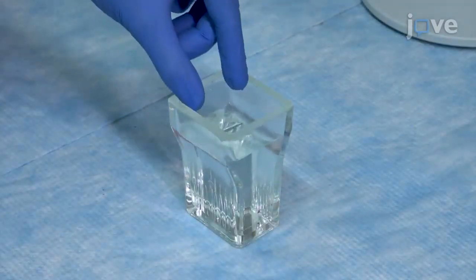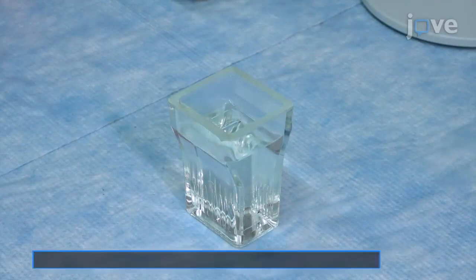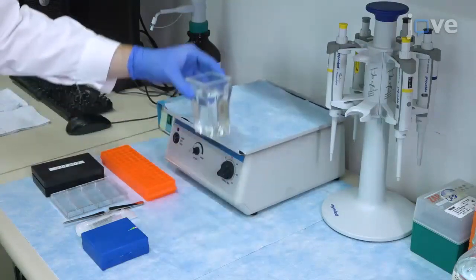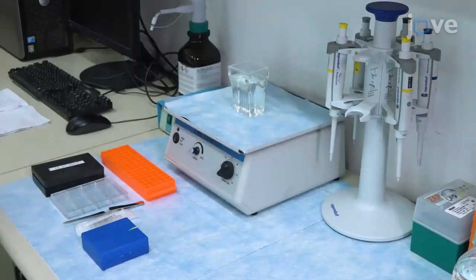Place the slide in a Coplin jar containing 0.01% triton X-100 and rotate on a lab rotator at 125 rpm for 5 minutes.